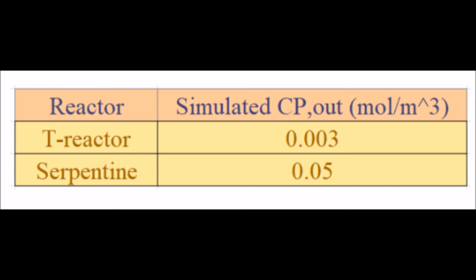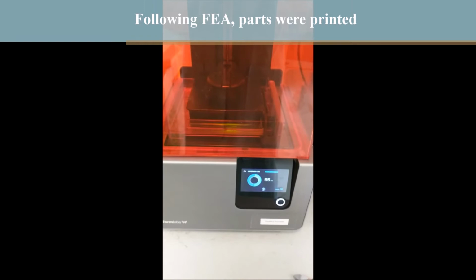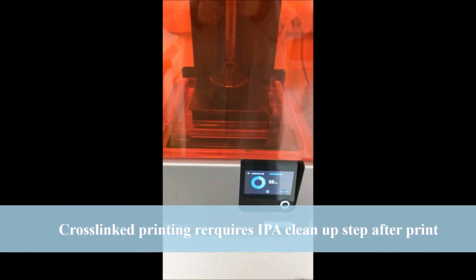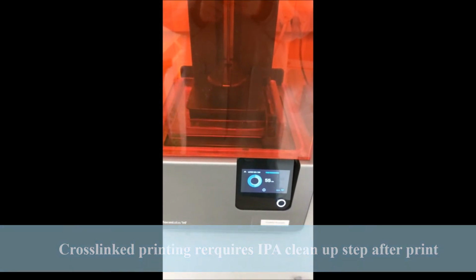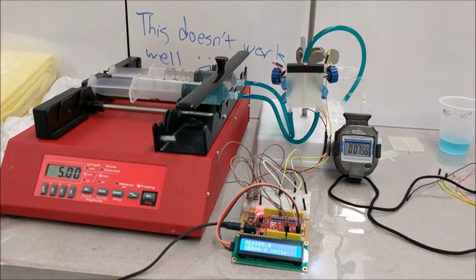Once the outlet concentration of product was verified to be significantly higher than the T-reactor, the new design was ordered for printing. Reactor designs were uploaded as STL files to the 3D printers. They were printed with cross-linked epoxy, and the finished product was soaked in IPA. IPA was later pushed through the reactor to remove any uncross-linked material and to ensure there were no leaks or obstructions. Once the design was printed and ready for use, it was placed in the test stand.